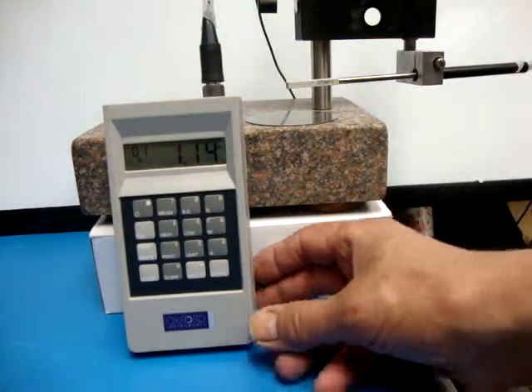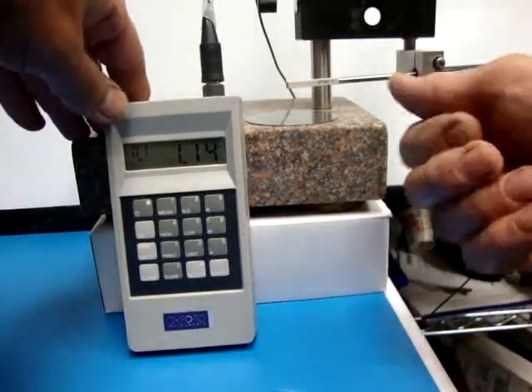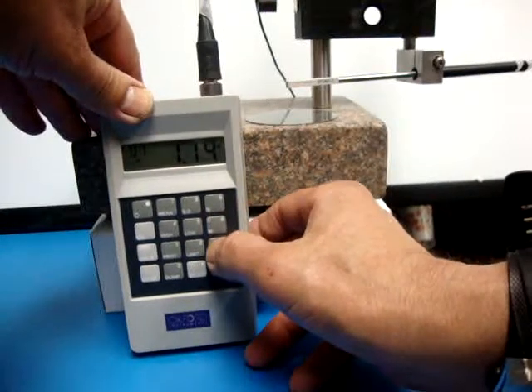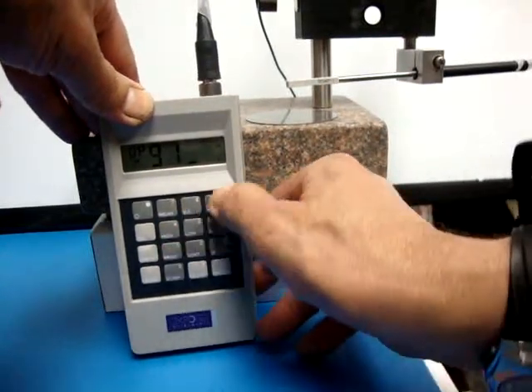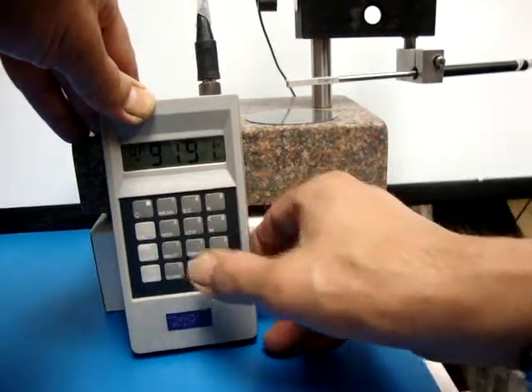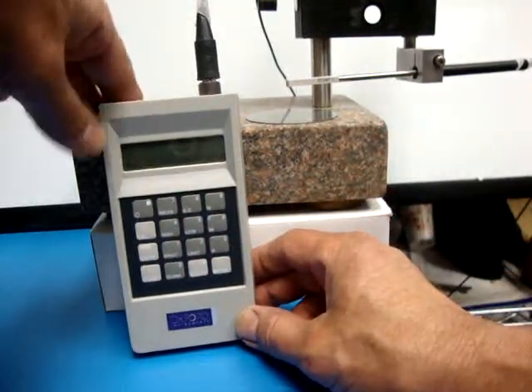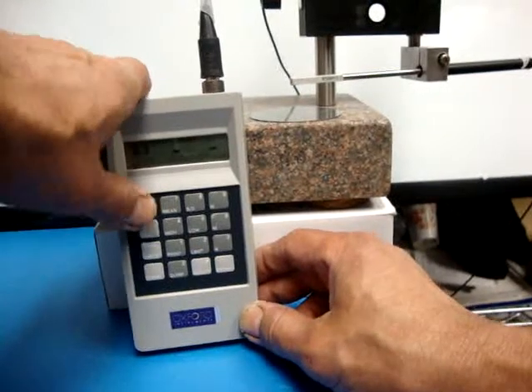This is your gauge out of the case. Since I'm doing it for the first time and every probe has a different offset, I want to start out by doing a star 9191 to clear out the memory. It powers off on its own, then you power back up.